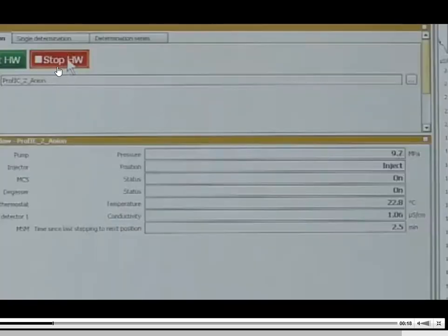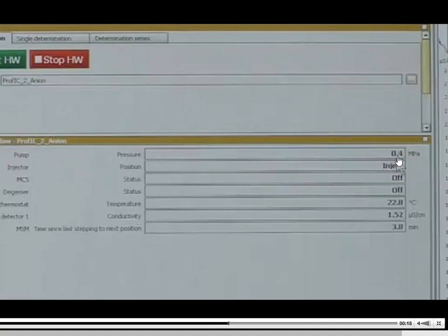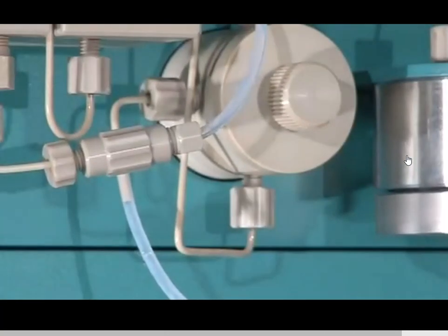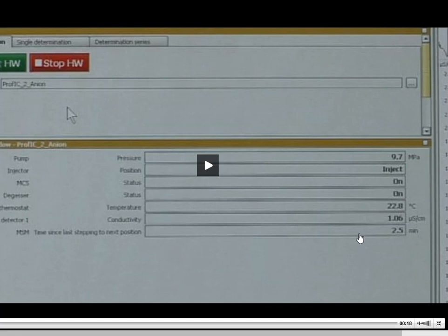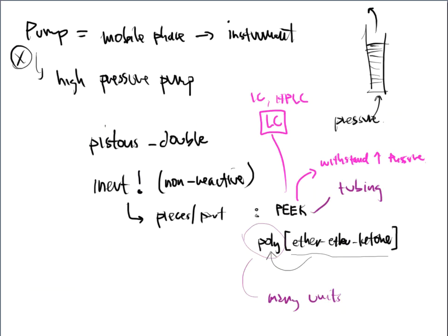What you're going to see is that they're going to stop everything from running, and they're going to open the purge valve up, and notice how this pressure plummets. It gets lower and lower. That's a sign that there is an open thing in your system. This pressure is decreasing, and that's a very good sign that you can go on to the next stage and do what you need to do from that point on. All right, so that's a little bit about the pump area of the instrument, and I think that gives you a better idea of the maintenance and the care that needs to come along with having an operational pump on an IC system.